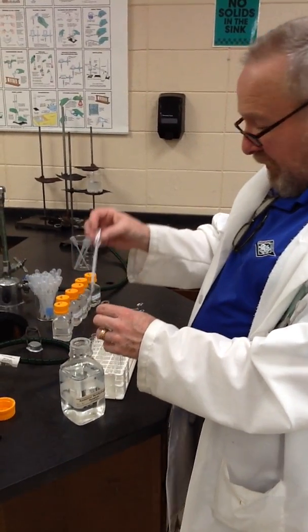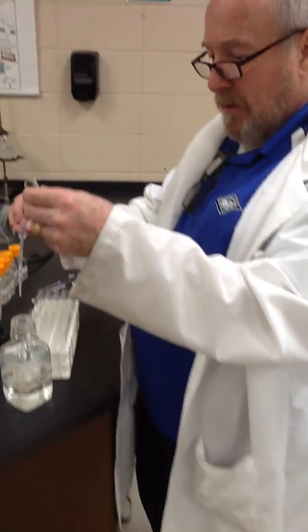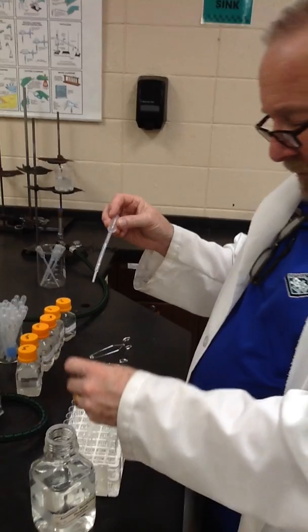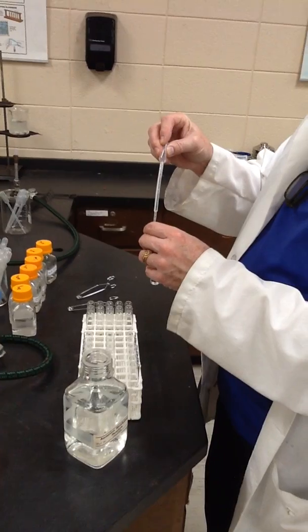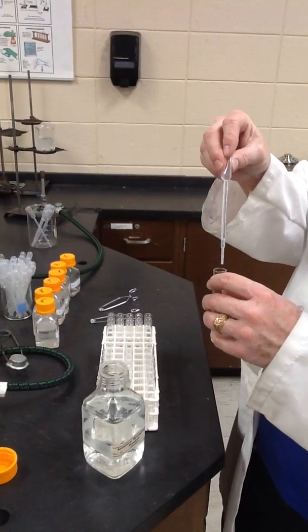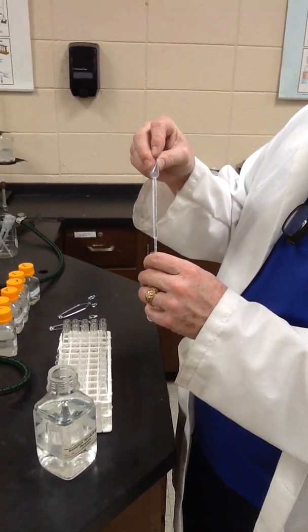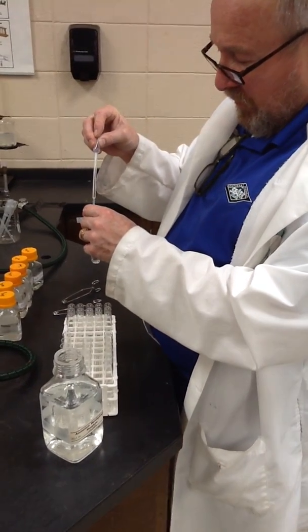So to the barium, 1, 2, 3, 4, 5. To the calcium, 1, 2, 3, 4, 5. To the lithium, 1, 2, 3, 4, 5. To the sodium, 1, 2, 3, 4, 5. To the potassium, 1, 2, 3, 4, 5. And to the strontium, 1, 2, 3, 4, 5.